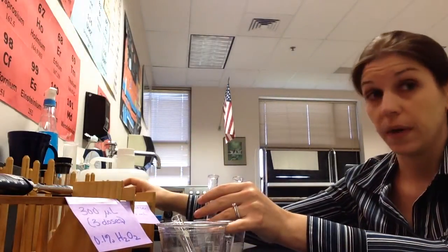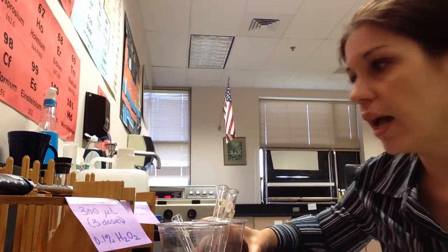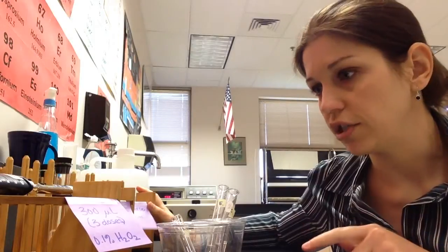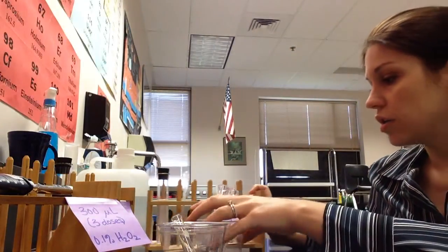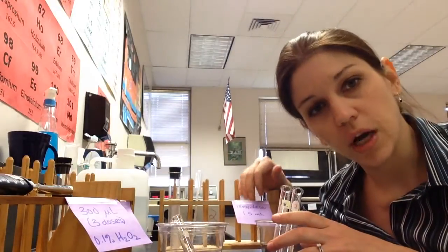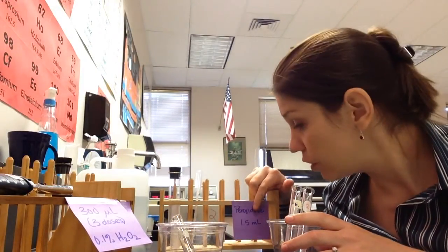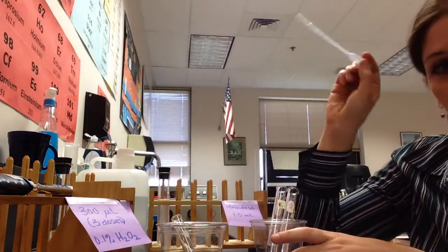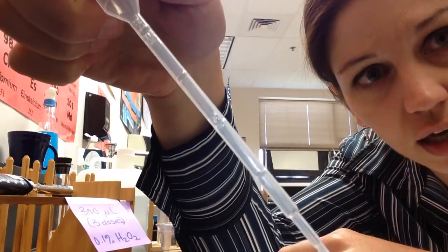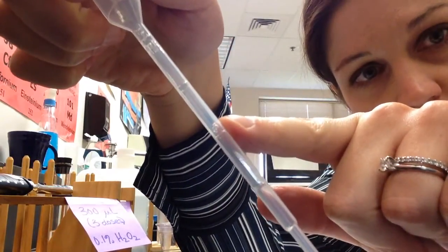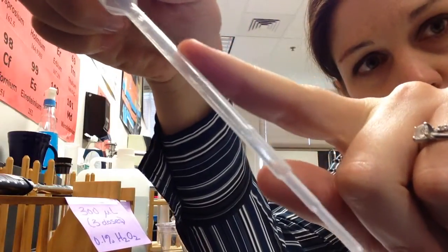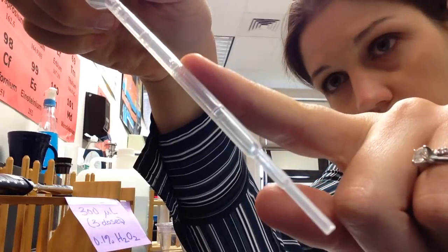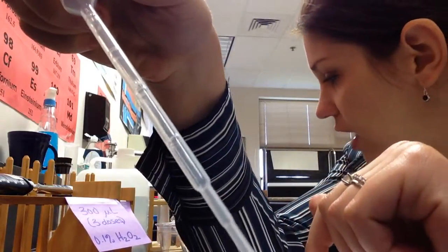The only other thing I need for my enzyme tube is my enzyme. And so I will have wooden test tube racks setting up in a couple of different locations, clearly labeled with what's what, because I don't want you guys to get the wrong stuff. And that's really the only way this lab can go wrong. So here's your enzyme, your peroxidase. It's clearly labeled peroxidase, and it tells you how much of it you need in case you got confused. You need one and a half mils. In order to measure one and a half mils, we're actually going to use a graduated pipette. This is not a micro pipette, but a graduated pipette has these little lines on it that tell you exactly what the measurements are. So there's one mil. And then right there is half a mil. You can see the little 0.5. So you have to do fill it up first to the one and then the second time to the 0.5, in order to get your one and a half mils. And then you'll put that in your enzyme container.